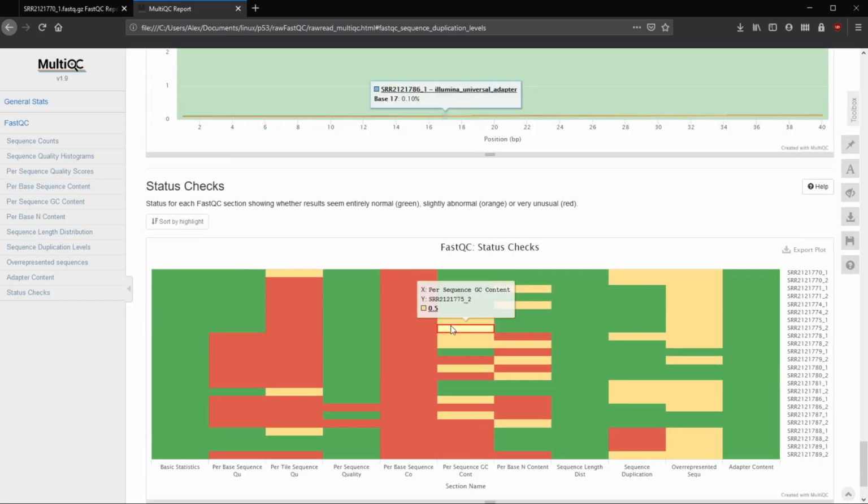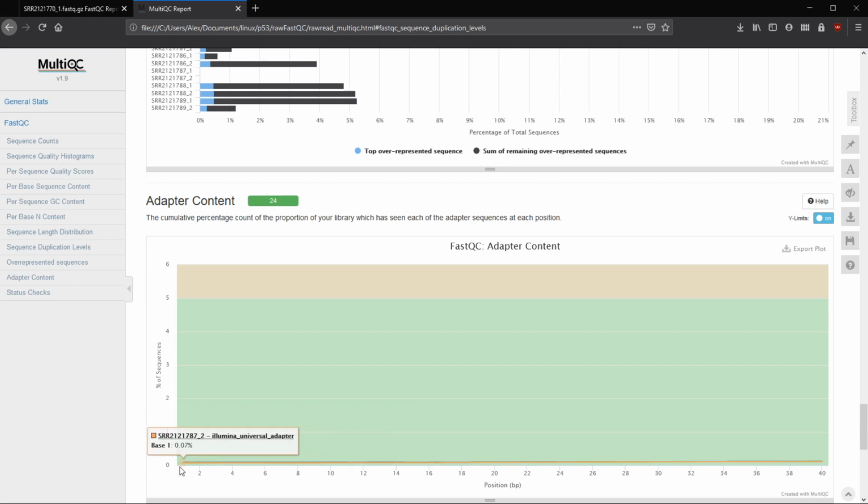This doesn't show it the best, and we don't have any, but this might be a little bit easier too. So at the very beginning here, we have 0.09, and at the end we have 0.11 and 0.12. So it increased. So why does that happen? Well, as soon as FastQC identifies a base call that has adapter content to it, that's going to stick with that sequence. So if it finds it here, and doesn't find another location that has an adapter sequence in it, at the end, the least that it could have is what it started off with. But since it did find another location along the line that had adapter sequence content, it did go up.